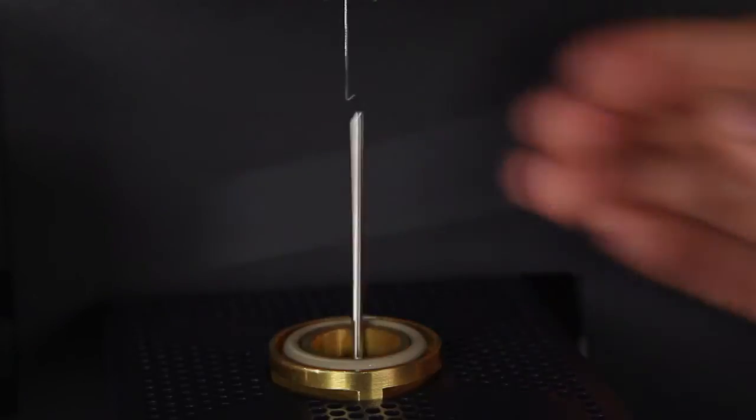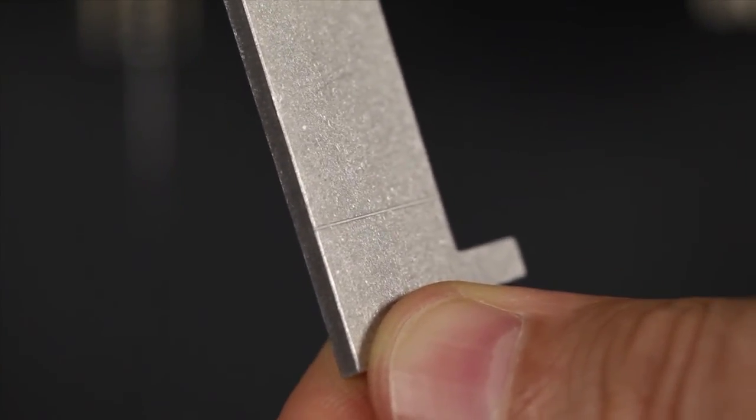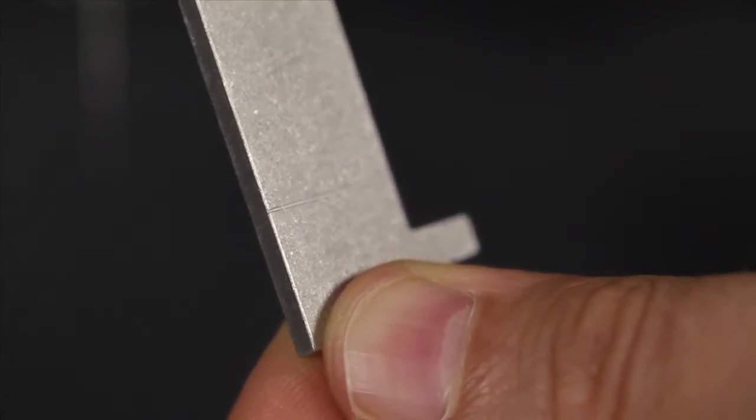Drop the installation tool down to remove it from the upper furnace assembly. We'll align the bottom part of the upper furnace assembly to this notch on the gauge, like this.